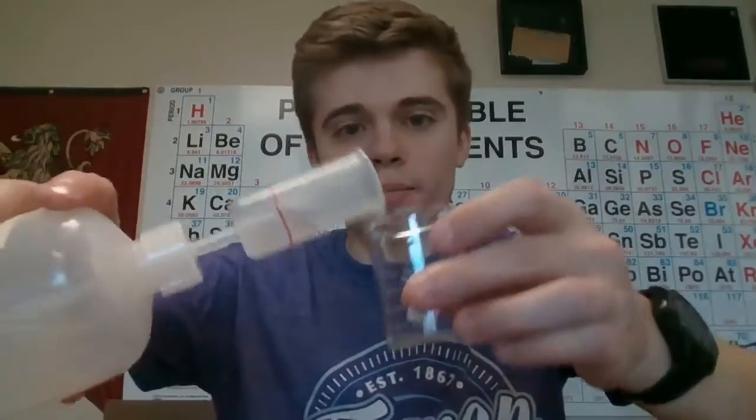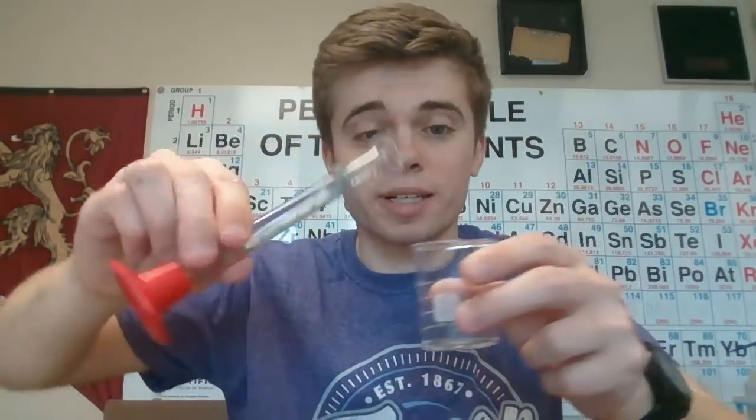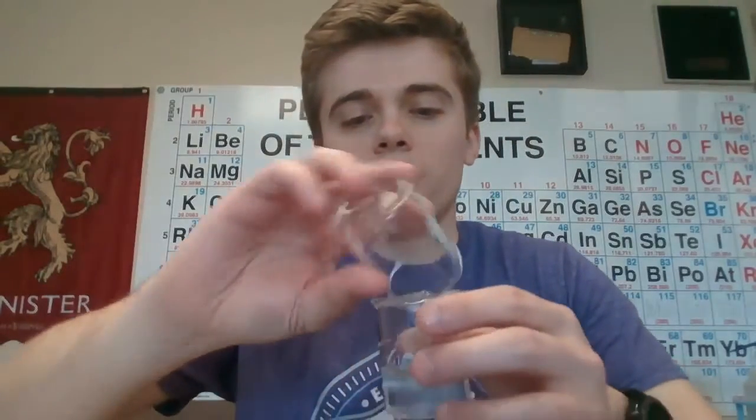Okay, now we're doing our third trial of part 1. So now this is where we're mixing 10 milliliters of solution B, which I've measured out right here, so it's all ready to go. And we're going to do 8 milliliters of the solution A with 2 milliliters of water. So I went and mixed that into here, and then dump it into here. We're going to mix these two solutions together, and once again, start that time as soon as I mix them together, and then stop it whenever they turn blue.